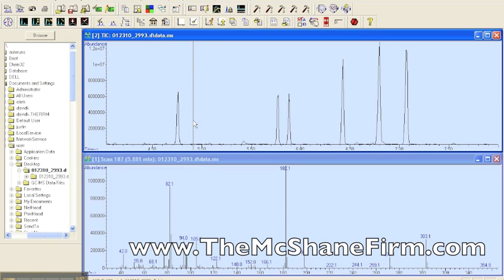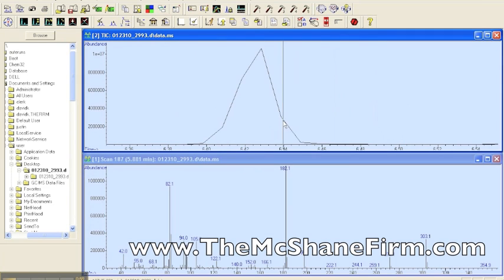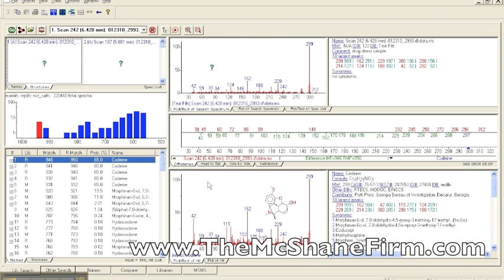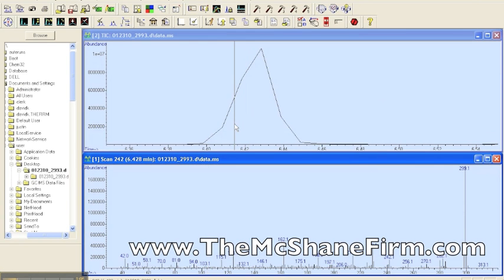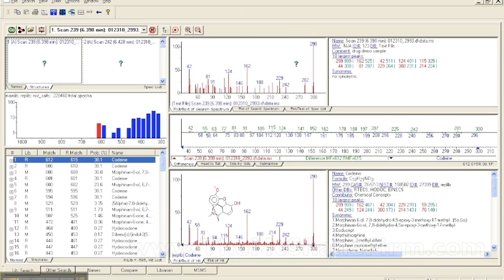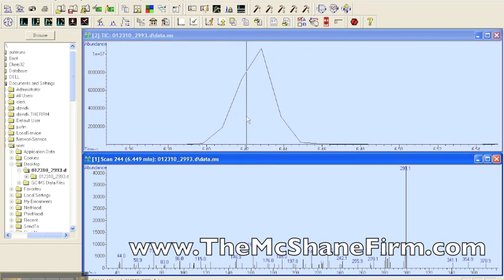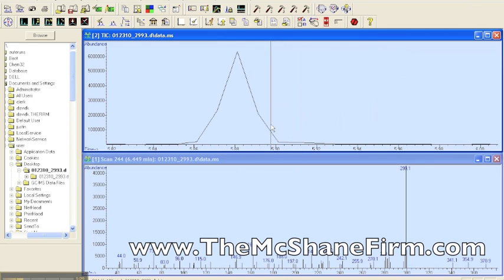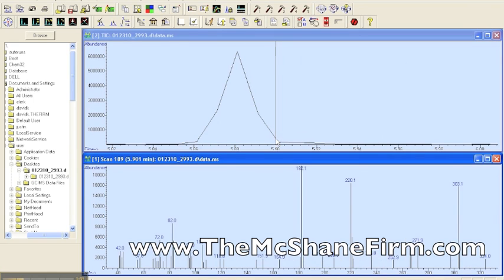So let's contrast that with a well-resolved peak, and let's go with this one. And you right double click on here, right double click, codeine. And no matter where you click on it, codeine. So, I mean, it really does matter where you click on these in order to get the results and where the results matter. So back over to here. Let's see the difference in the reporting styles.